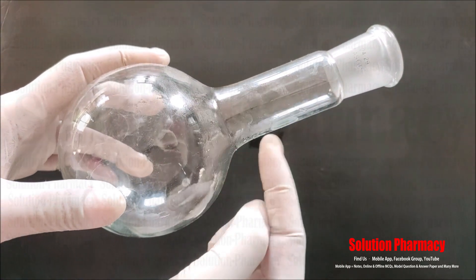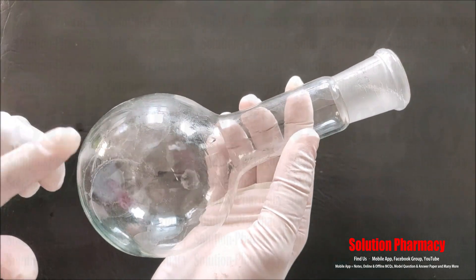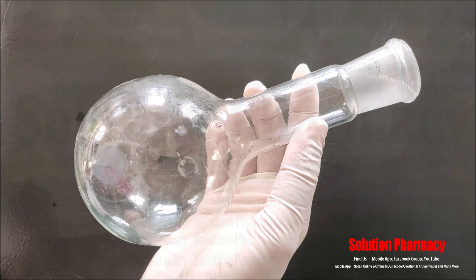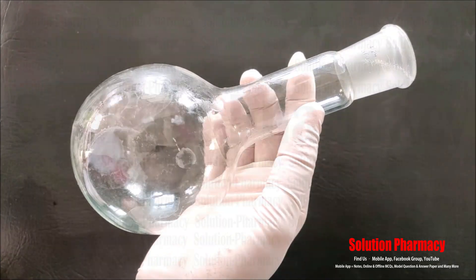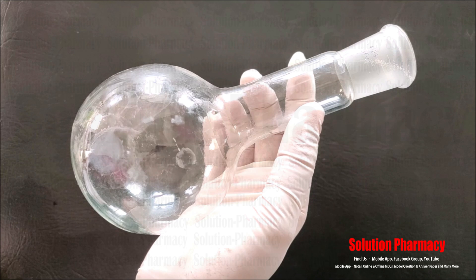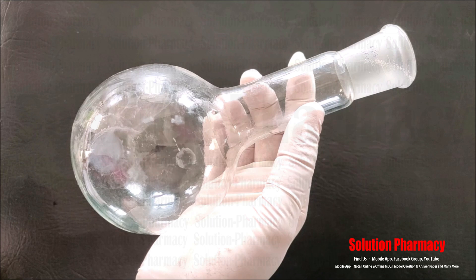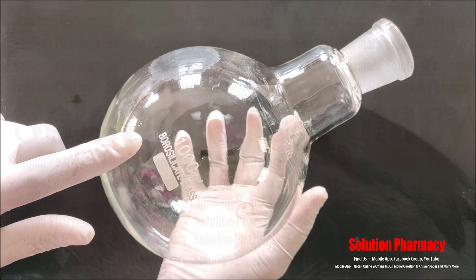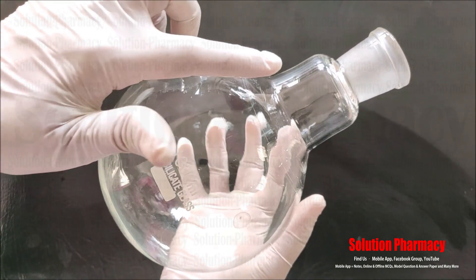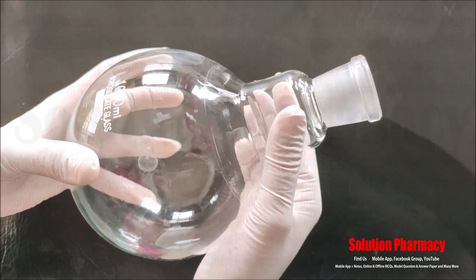Next, this glassware is called a round bottom flask because the bottom of this flask is round and not flat — it is spherical in shape with a long narrow neck at the top with joints, where a condenser or other apparatus is attached. Due to the round bottom, uniform heating of the substance takes place when heated over a heating surface or heating mantle. This round bottom flask is generally used for distillation, chemical reactions, chemical synthesis, and heating liquid samples.